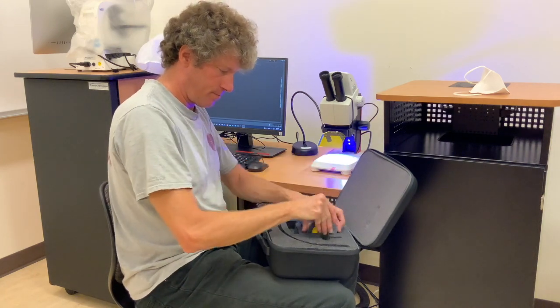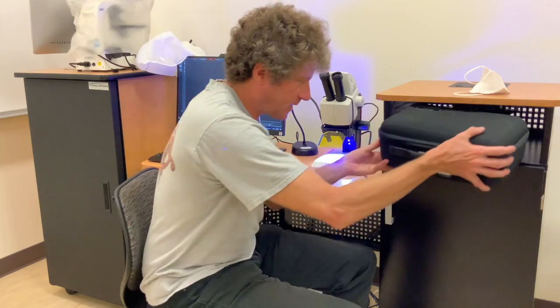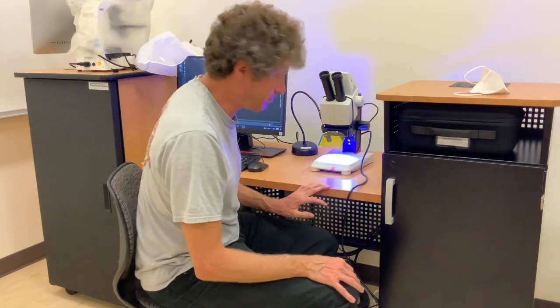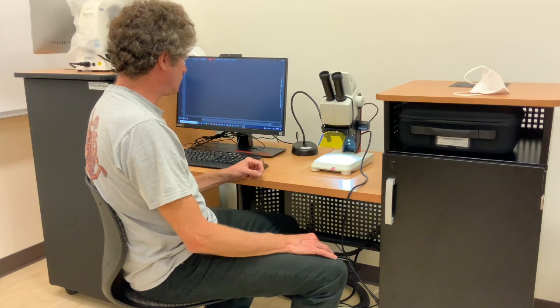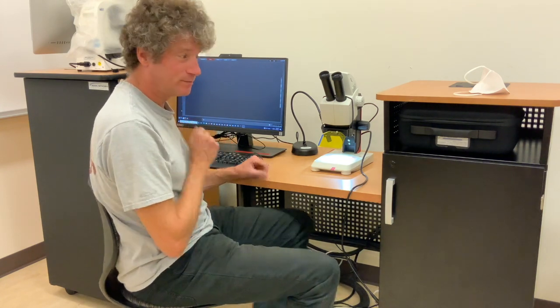It goes back into this little slot right here and is going to be kept right there. Please keep these scratch free — they're not cheap. You can turn the LEDs on and off here. I'm going to show you some samples on the software and how to use LASX, but it's the same as the other Leica machines.